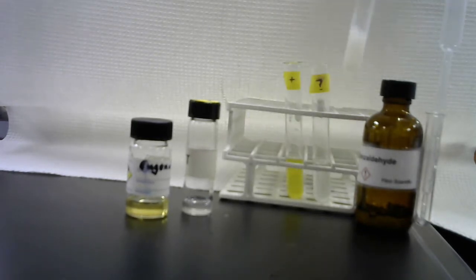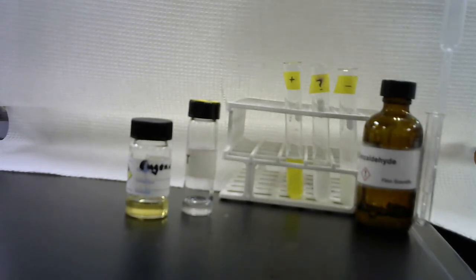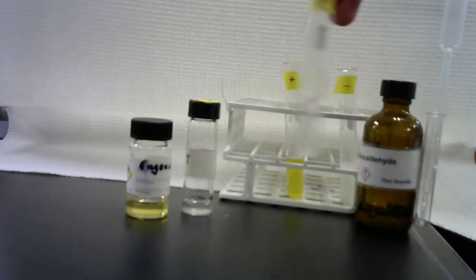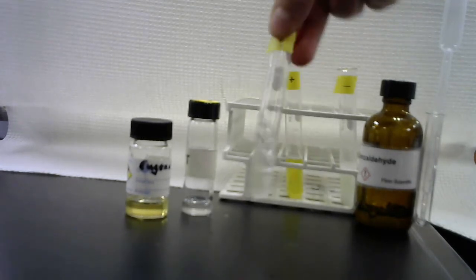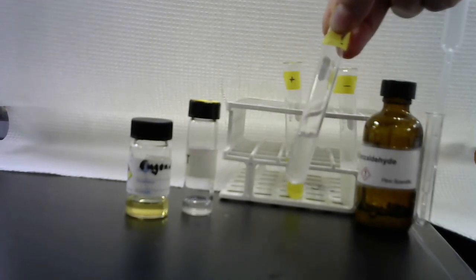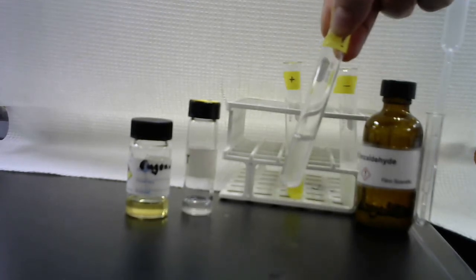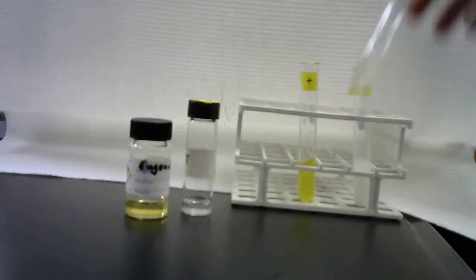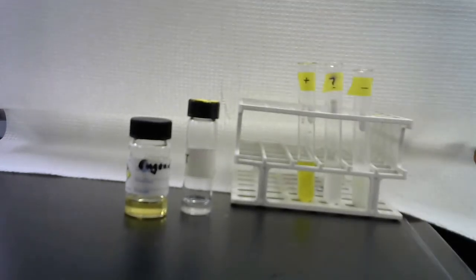So benzaldehyde is our known negative, and so unknown letter T. Oh yeah, now you can really see that bubble that settled to the bottom in the unknown. Sometimes with the solubility test, it's hard to tell. You have to look very closely. Maybe wait a minute.